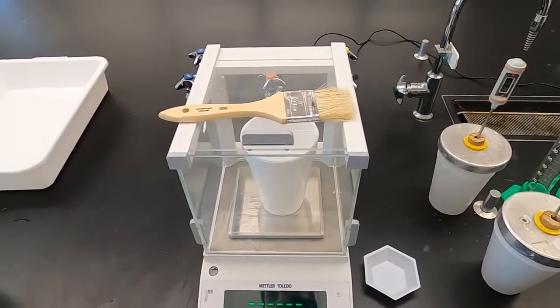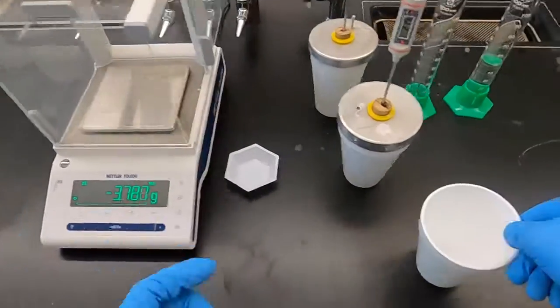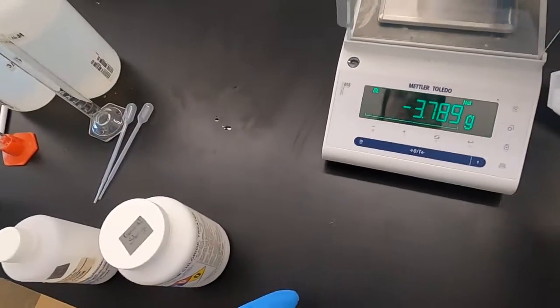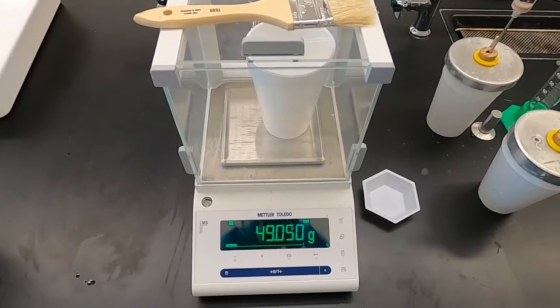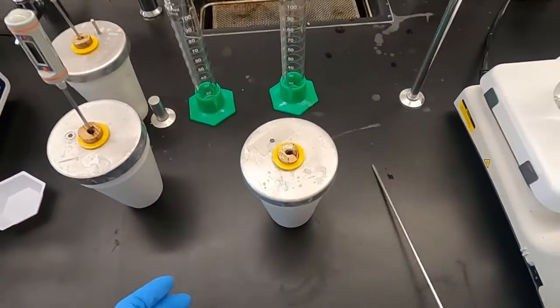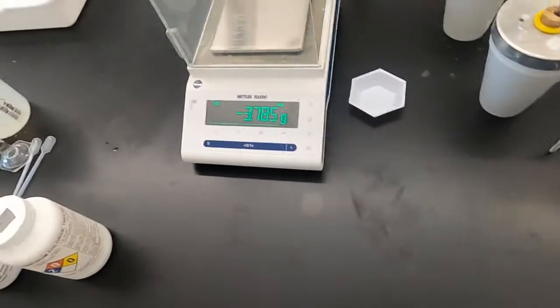So now, this is for our calcium chloride. We're going to zero out our cup. Again, I didn't put a mass now that we know of that trick. And pour our 50 mils in. Make sure all of it is out. And our mass of the water for calcium chloride, 49.050 grams. Same thing. Close the calorimeter. Put our thermometer in. Let that stabilize. We'll put the stirrers in a sec.